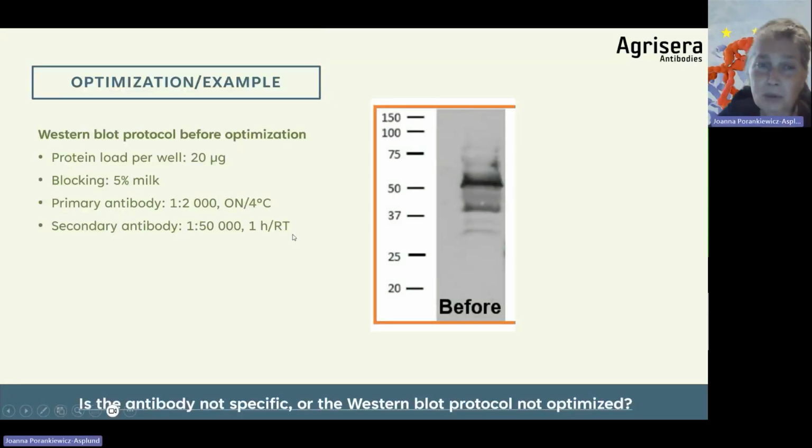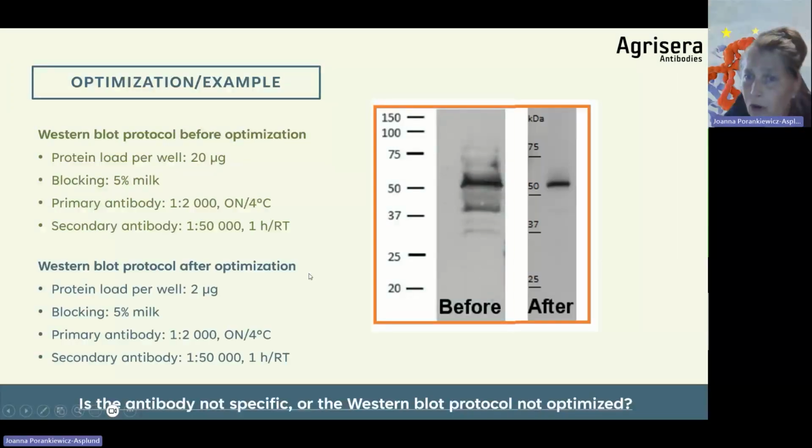Here is an example of optimization. This lab has been using the conditions as you see here. 20 microgram of protein was loaded. Blocking was done with 5% milk, and primary antibody was used overnight. Unspecific bands, right? The antibody is not really that good, or the protocol wasn't good enough. As you see here, the only change was using 10 times less protein load per well.